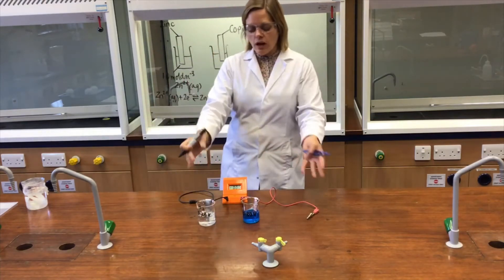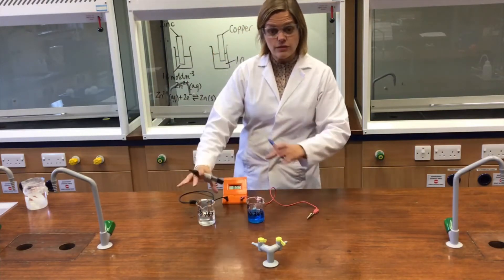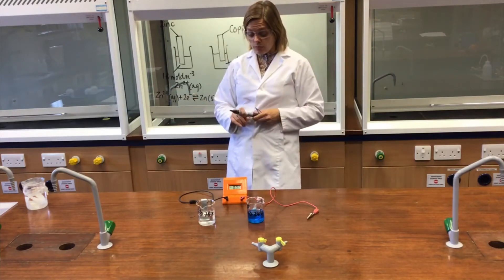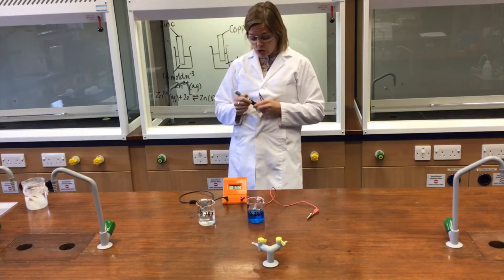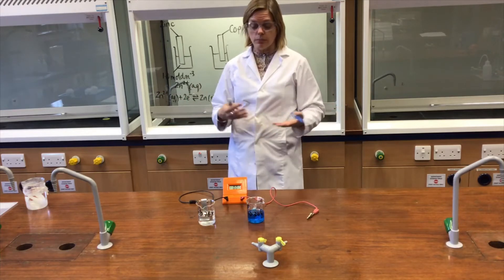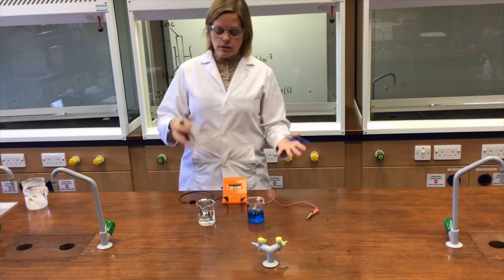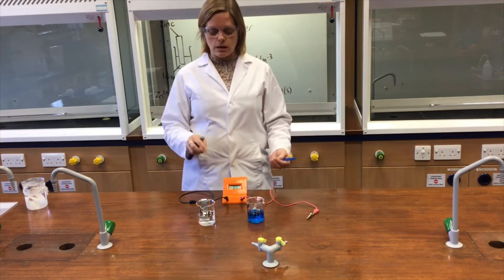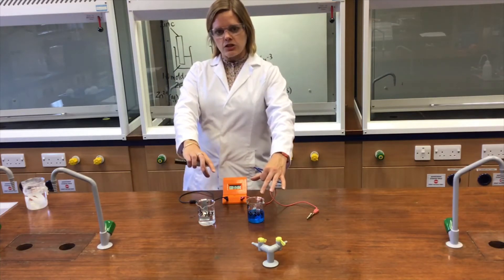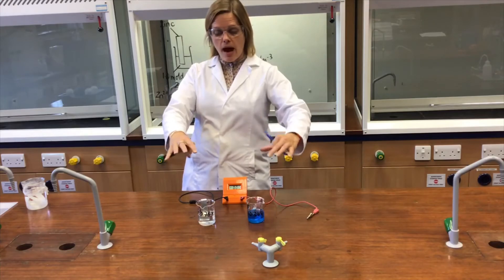Each half-cell is currently an individual closed equilibrium system. But if we choose to break the closed system and complete the circuit, we can exploit the difference in E° between the two half-cells and create an electromotive force — an EMF.